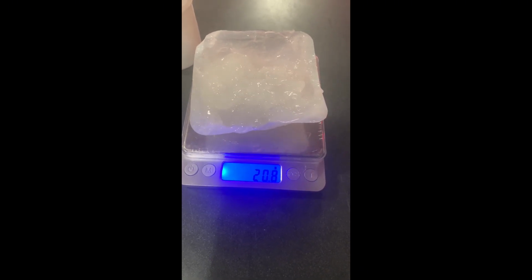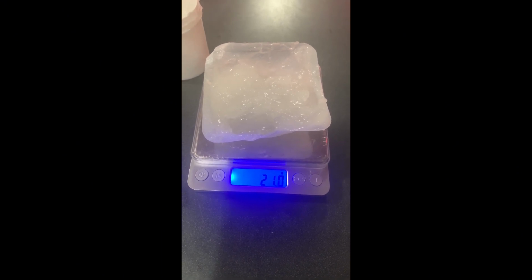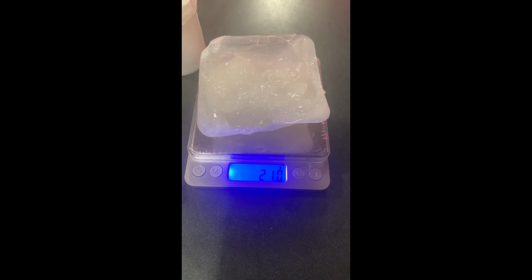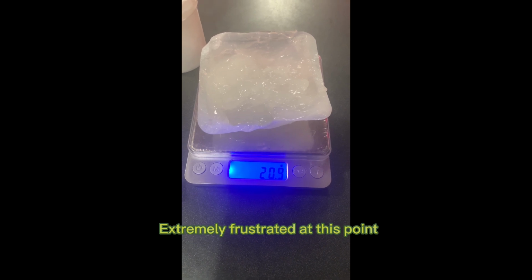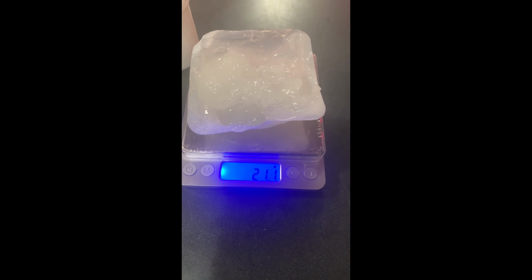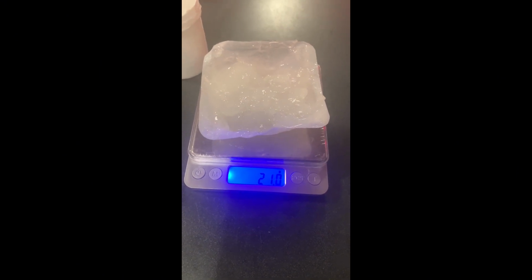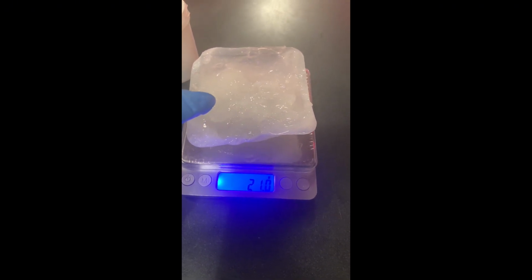So I'm at 20 point, it keeps moving. 21.0 grams, and I'm not even at the minimum or maximum allowable weight at all either. I don't know what to do. It's frustrating me, but again, 28.5 grams of the gel base is what you need.